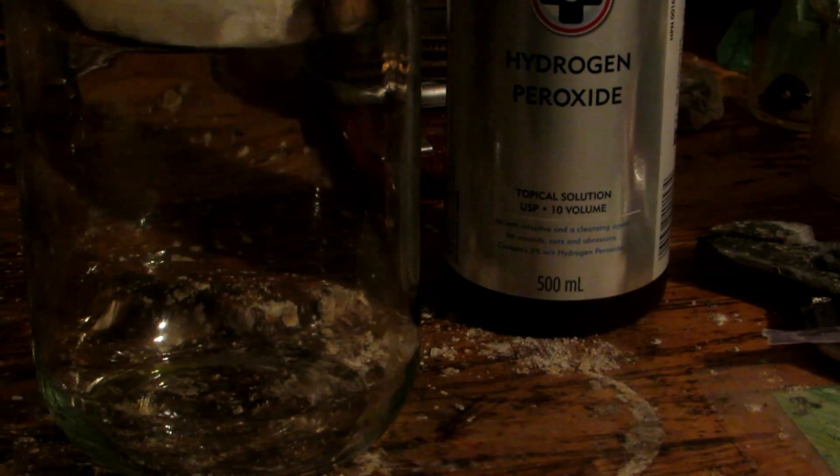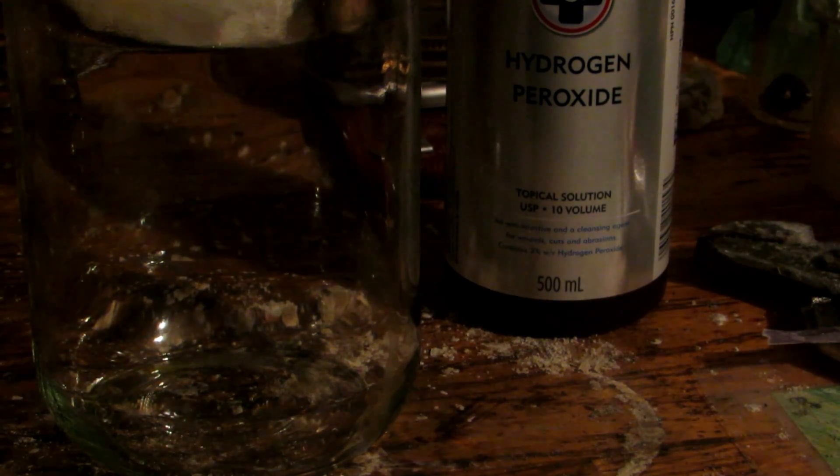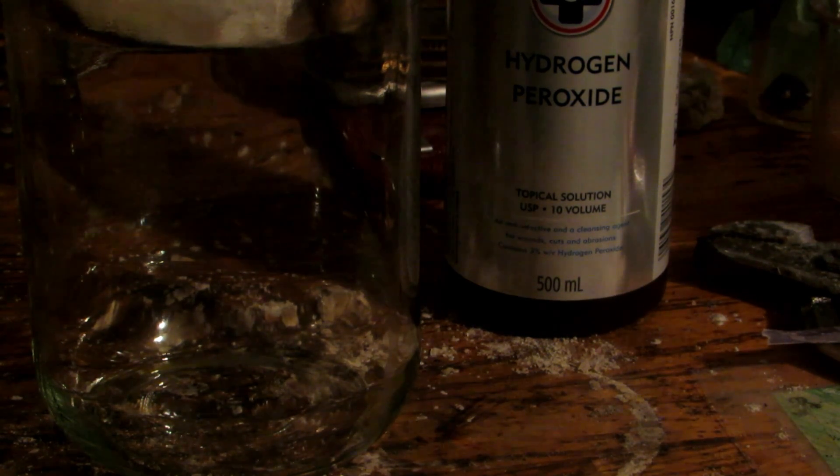First, we need to get a varying amount of copper metal — however much you want. I'll probably be using about half of this fairly long copper foil strip and just drop it in. Next, we'll cover it halfway with hydrogen peroxide and halfway with hydrochloric acid. Hydrochloric acid by itself is not strong enough to dissolve the copper metal and form copper chloride, but with the hydrogen peroxide, the H₂O₂ helps to oxidize the copper metal so it can then react with the hydrochloric acid to form copper chloride.